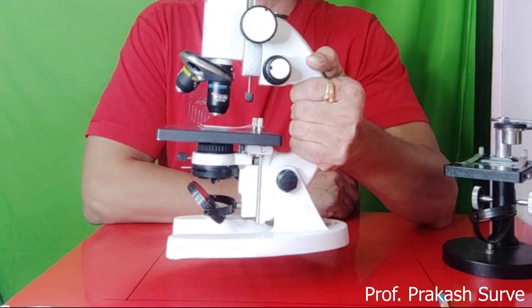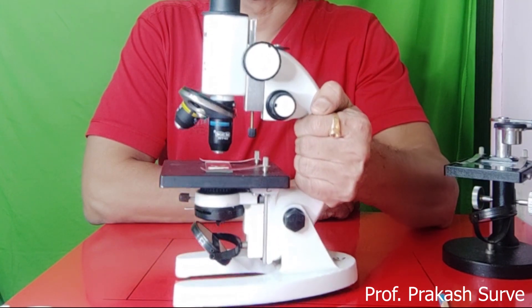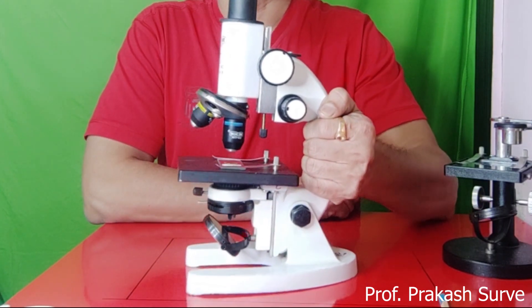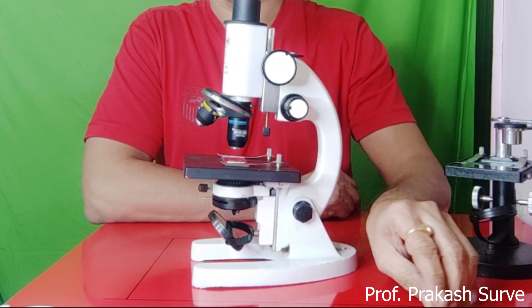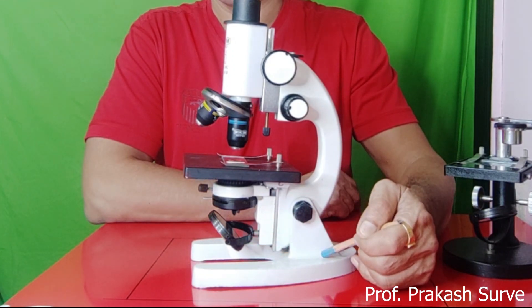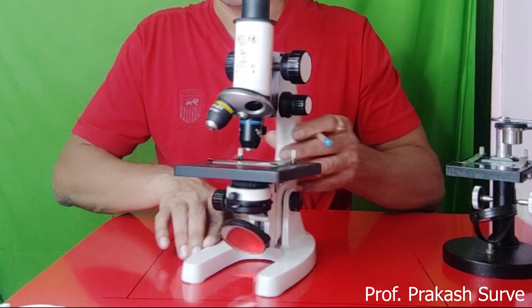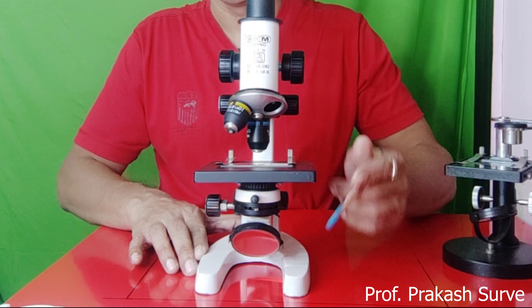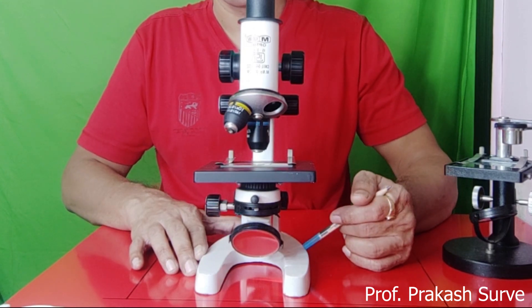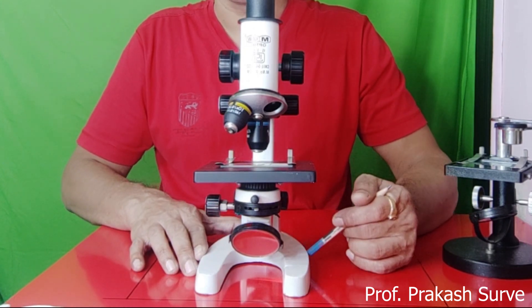Now we will see the different parts of the compound microscope. First is the base, also called the foot. It is a U-shape or horseshoe-shaped metallic base which supports the whole microscope.